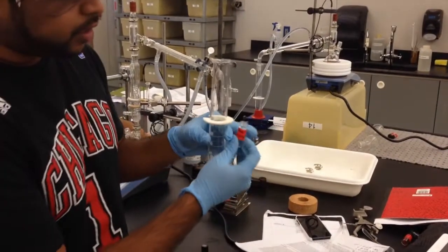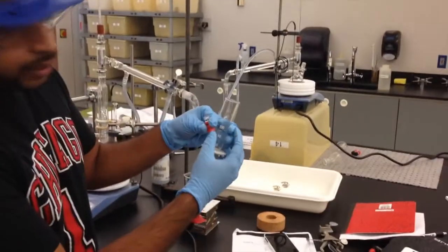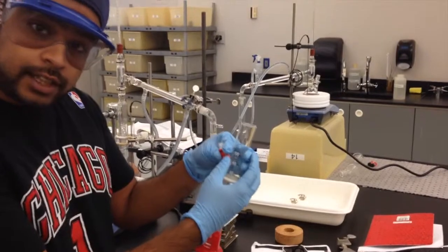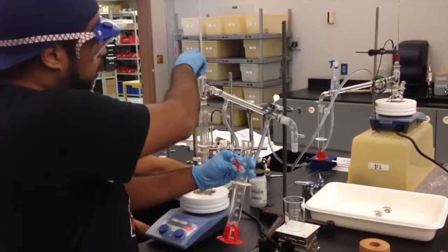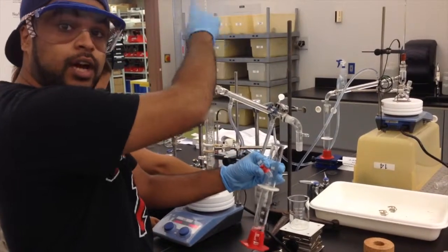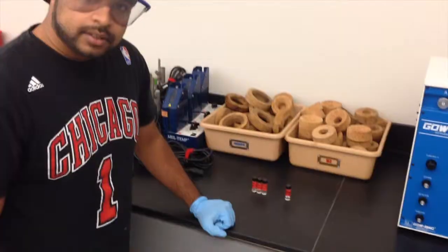After we collected our first sample, we collected up to 20 milliliters of our second distillation for our fractional distillation. Now we're going to go ahead and add some of this 20 milliliters over here to the GC so we can see the concentration at this point. The third time we're going to collect a vial is when the temperature shoots up beyond 85 degrees and we know that we're collecting basically cyclohexane. I'm sorry, toluene, not cyclohexane.